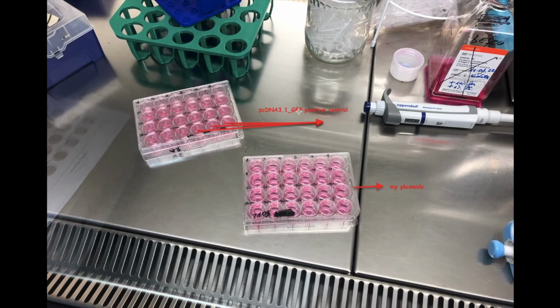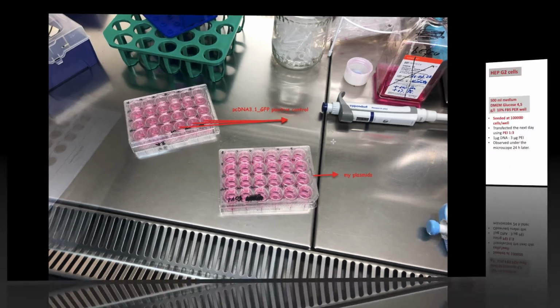It would be the positive control, so this would be a plasmid that is known to generate green fluorescence. This one is pcDNA 3.1 GFP. So this is a plasmid that is widely used in mammalian cell transfection. So let me show you how I've set up my experiment and tell you basically what went wrong.